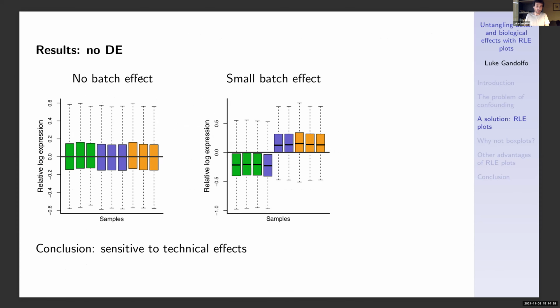So here are the results when we have no differential expression in the data, no biological effects. So if there's no batch effect, then the RLE plot looks as it should. The boxes are centered on 0 and they're roughly the same size. And if we insert a small batch effect, cutting the samples into 2 batches, these samples in one batch and these samples in another batch, we see the batch effect clearly stands out in the RLE plot. So this suggests the RLE plots are sensitive to technical effects. Well, great. So at least we're in business on that front.